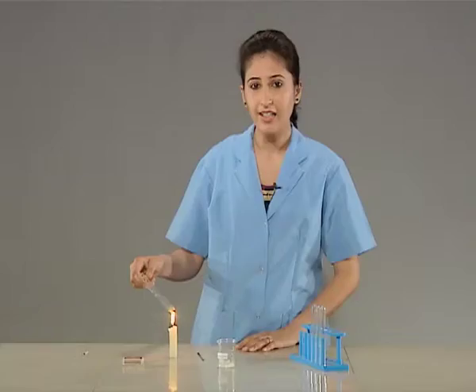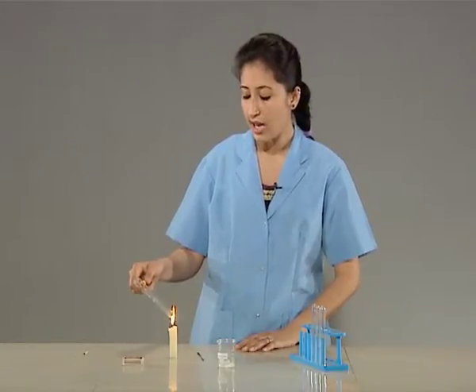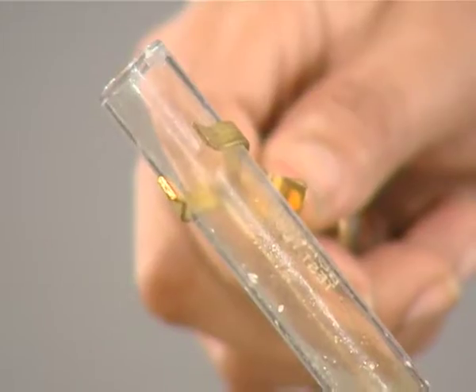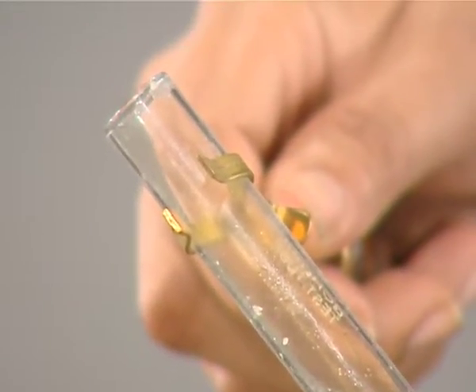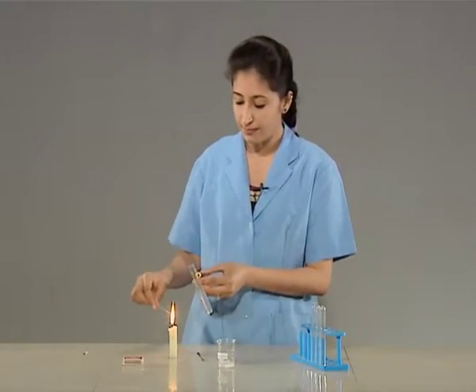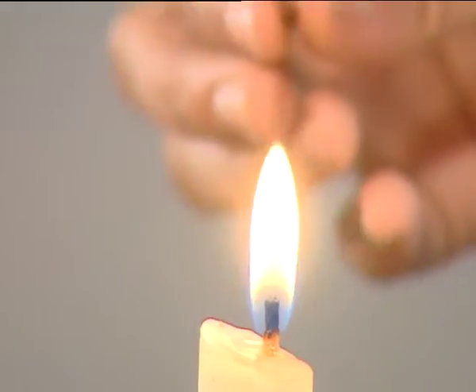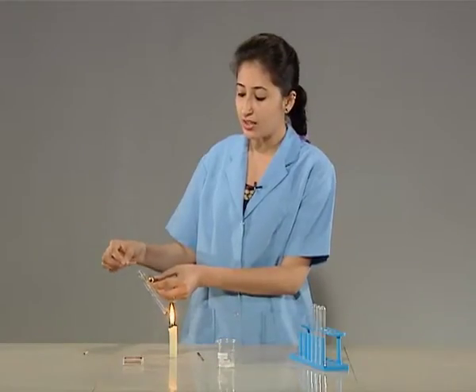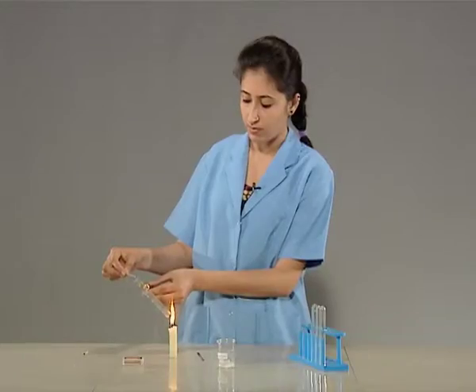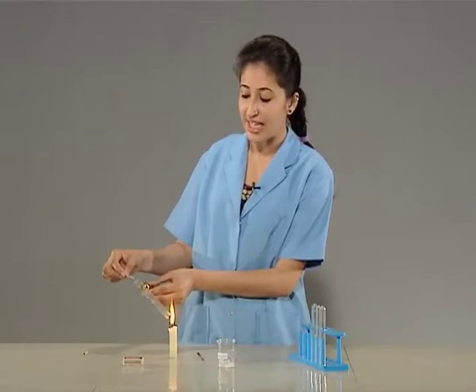On heating, lead nitrate produces a crackling sound along with the brown fumes of nitrogen dioxide. Let us burn the splinter and introduce this glowing splinter into the test tube. The splinter gets relit again.